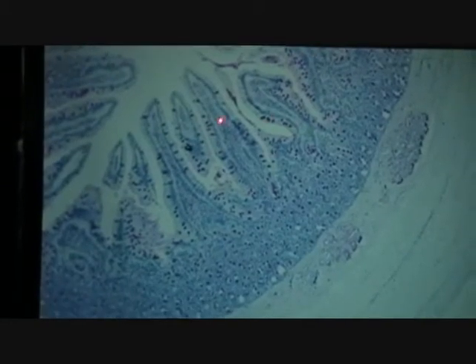Now you do know what these are, right? So don't let the staining throw you. These are villi, so it's got to be small intestine, right? That's the start. And that the little magenta bubbles are goblet cells. And that it's a special technique to show the special mucus that goblet cells make.